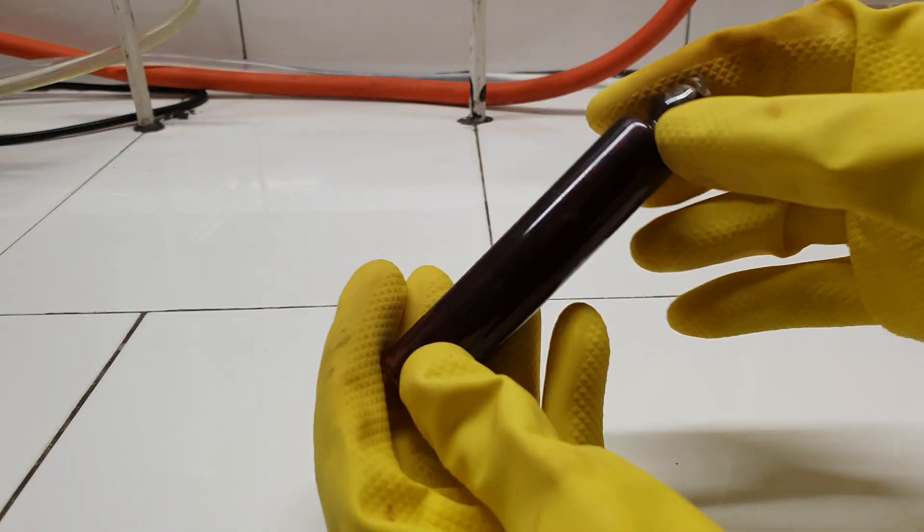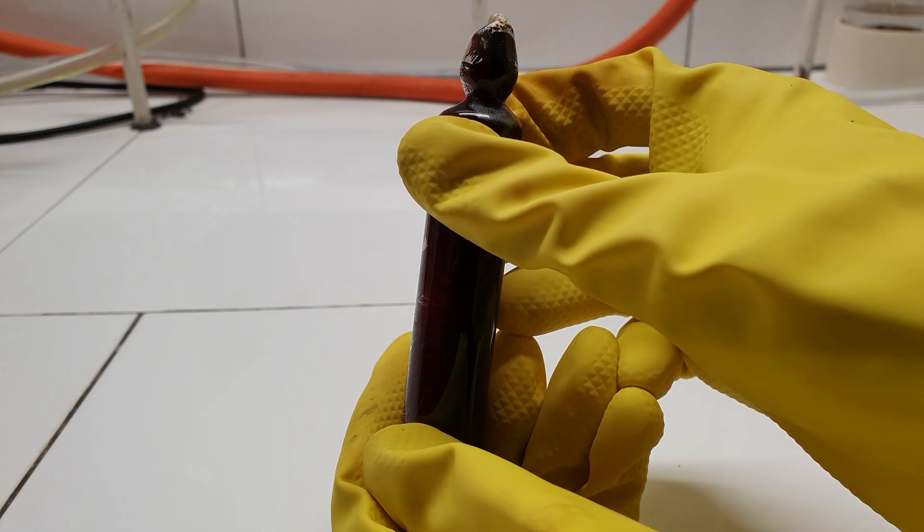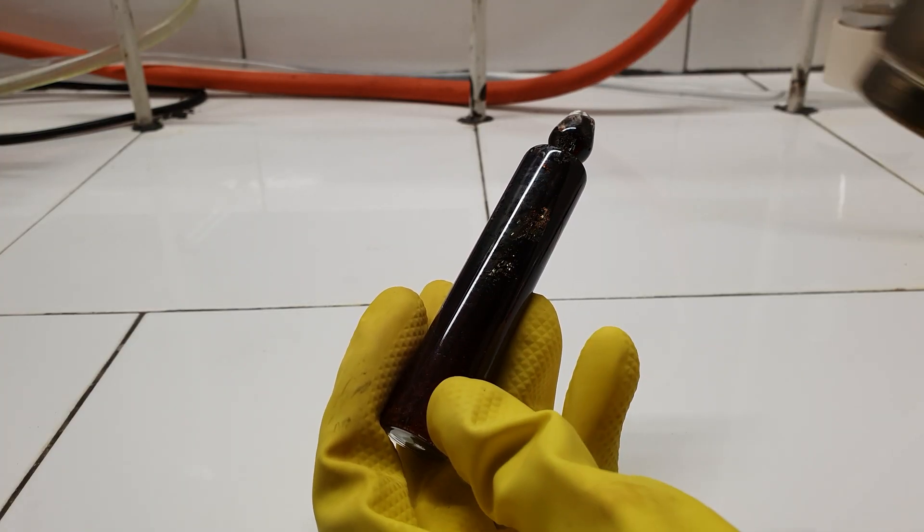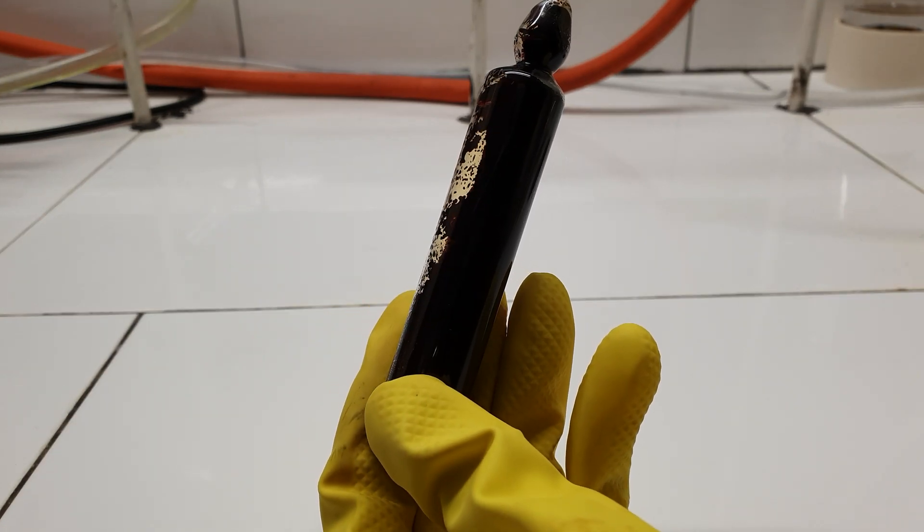Not only that, but the compound was all over the walls and I wasn't able to see the inside. To show you how the crystals looked like, I melted the thin layer which had formed by evaporation inside the ampule.